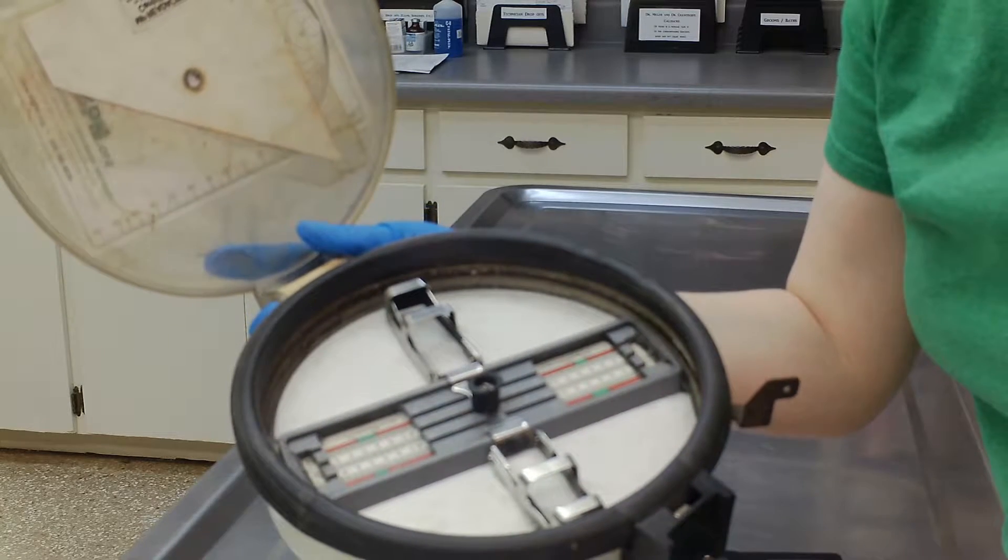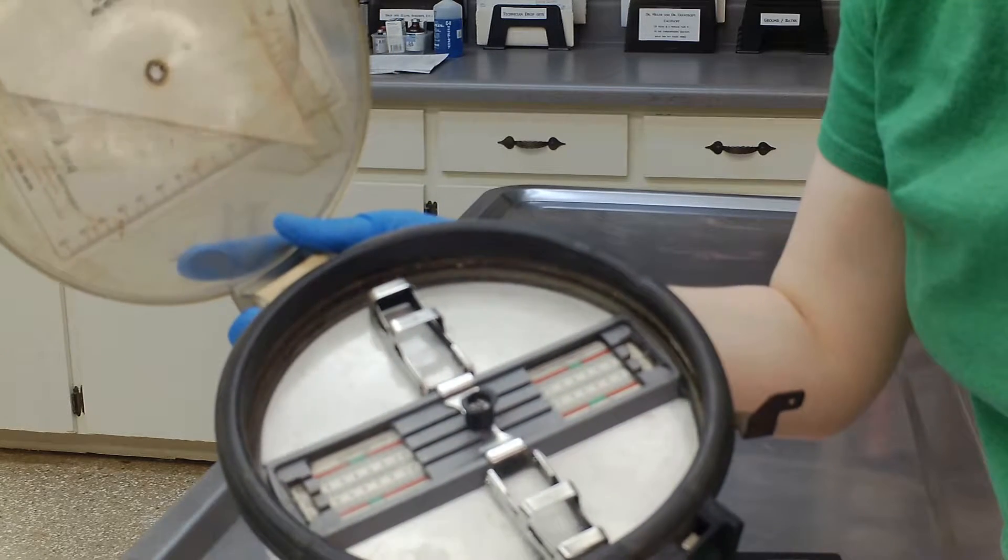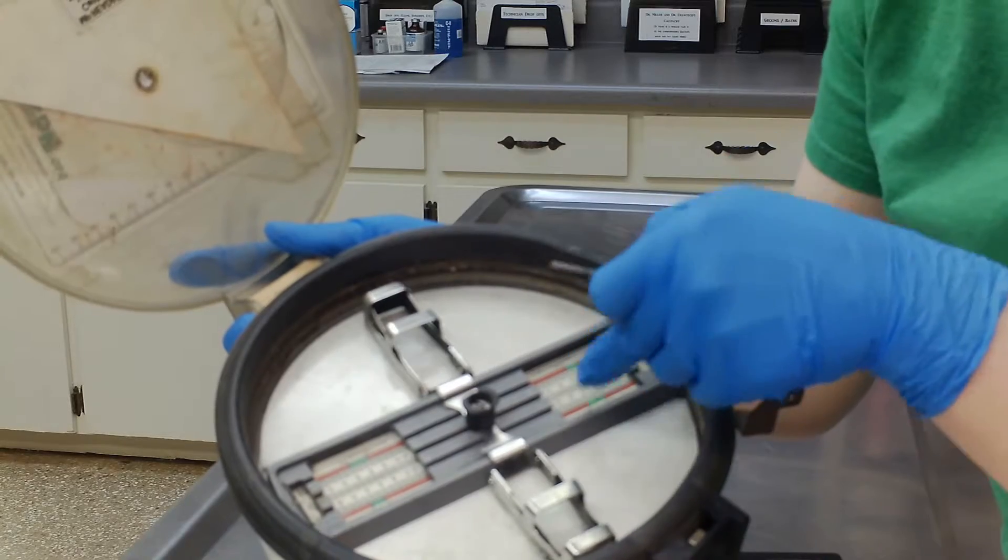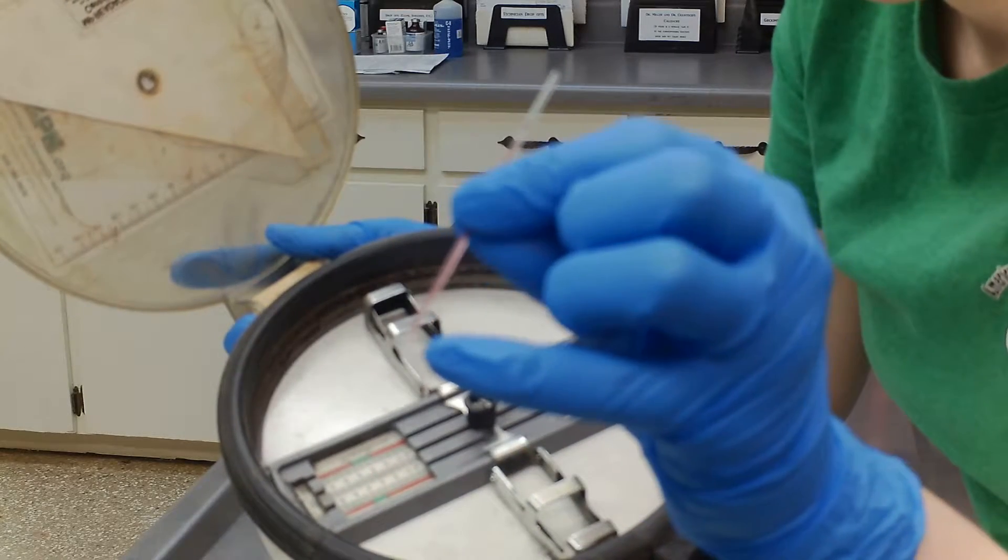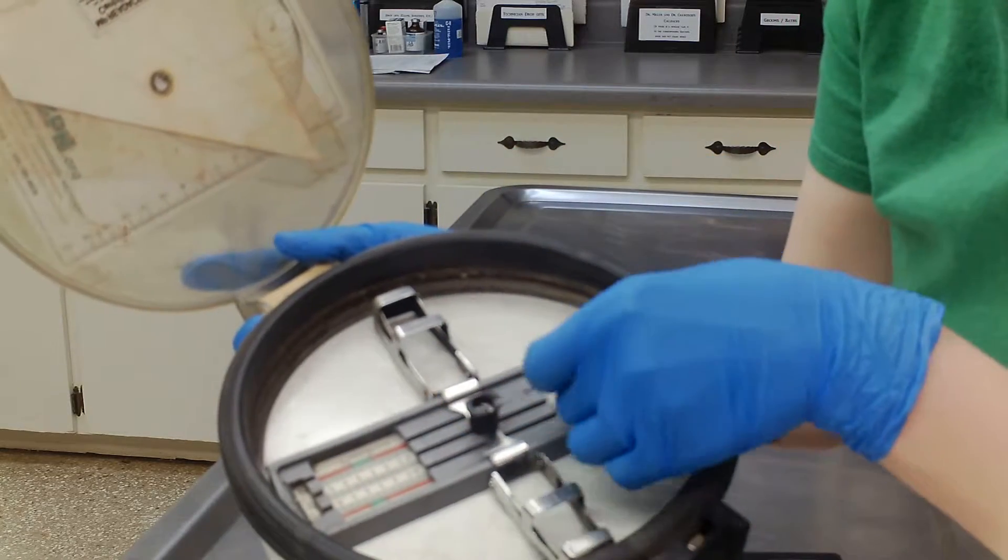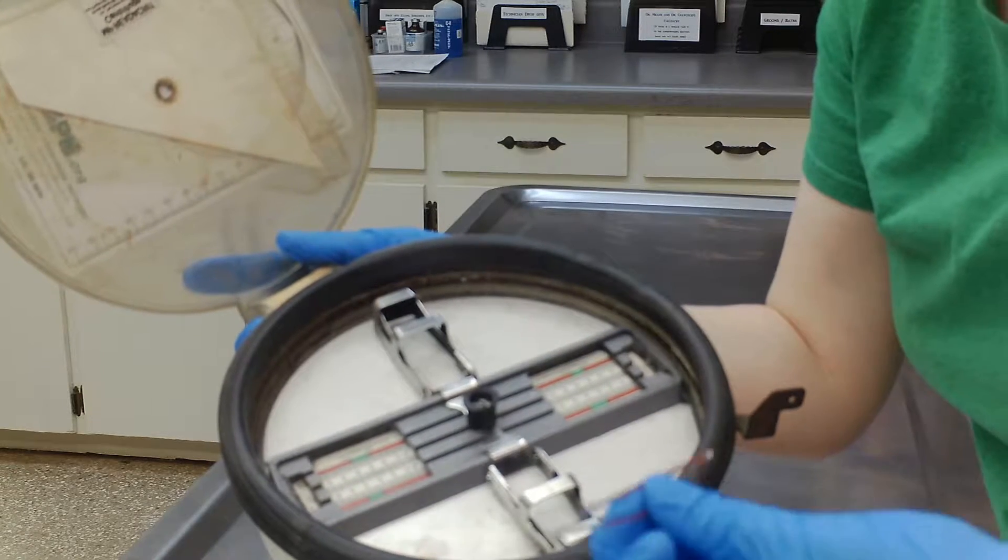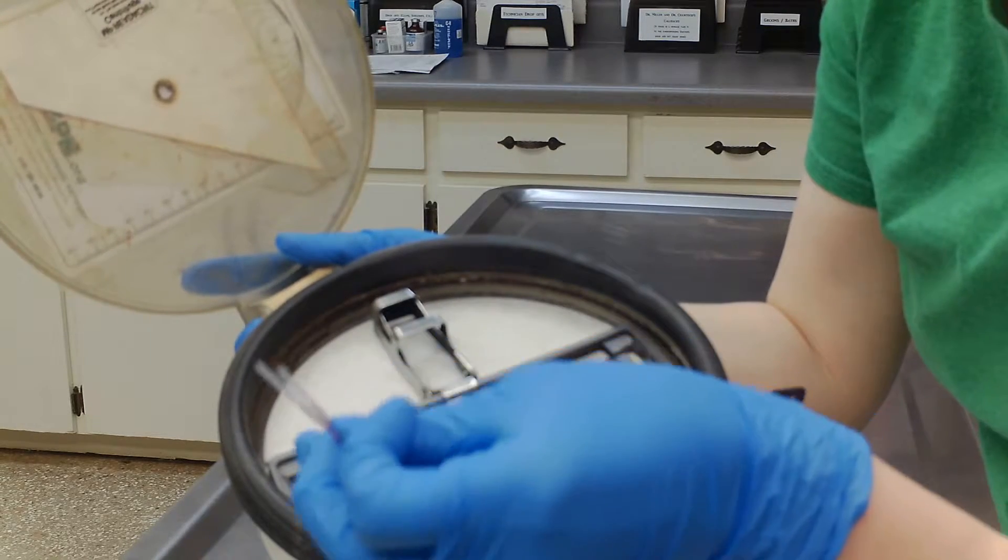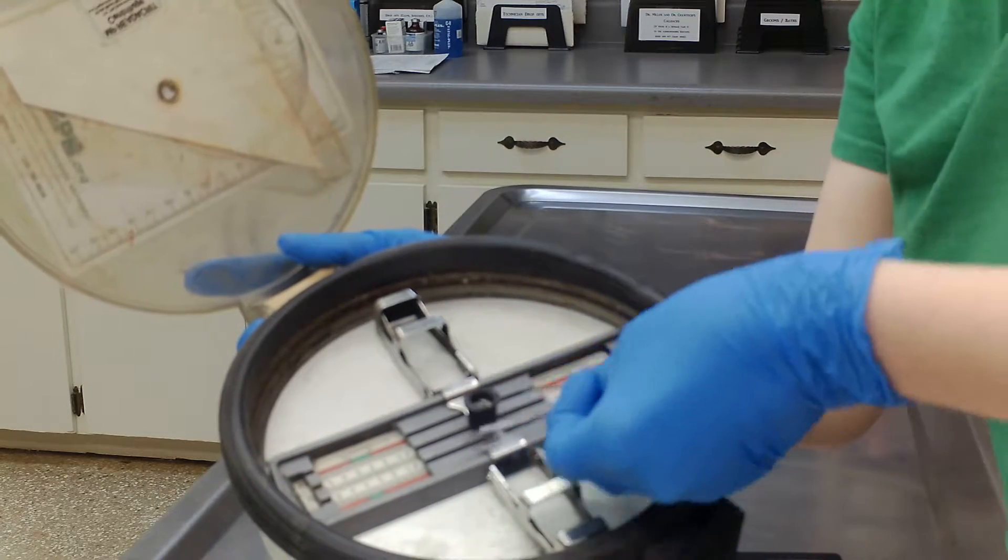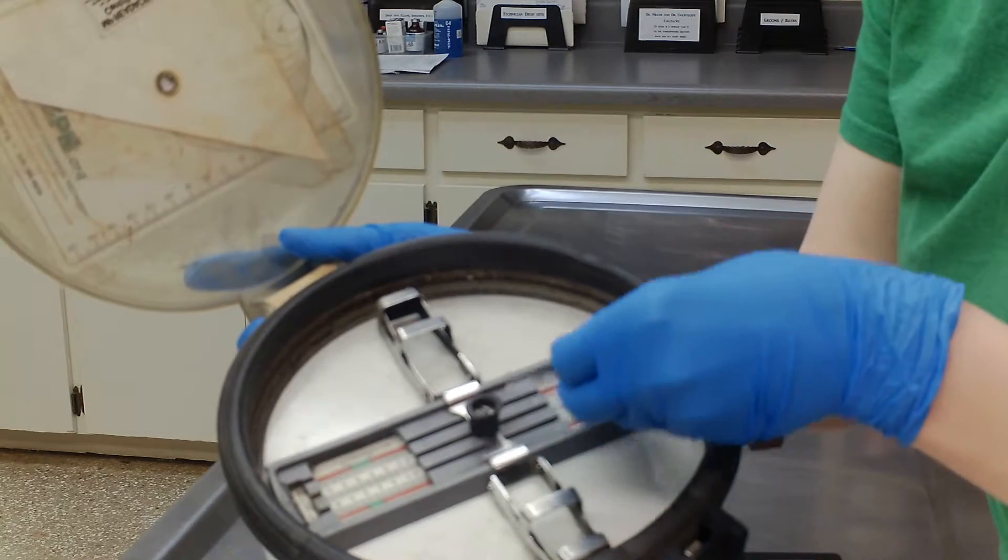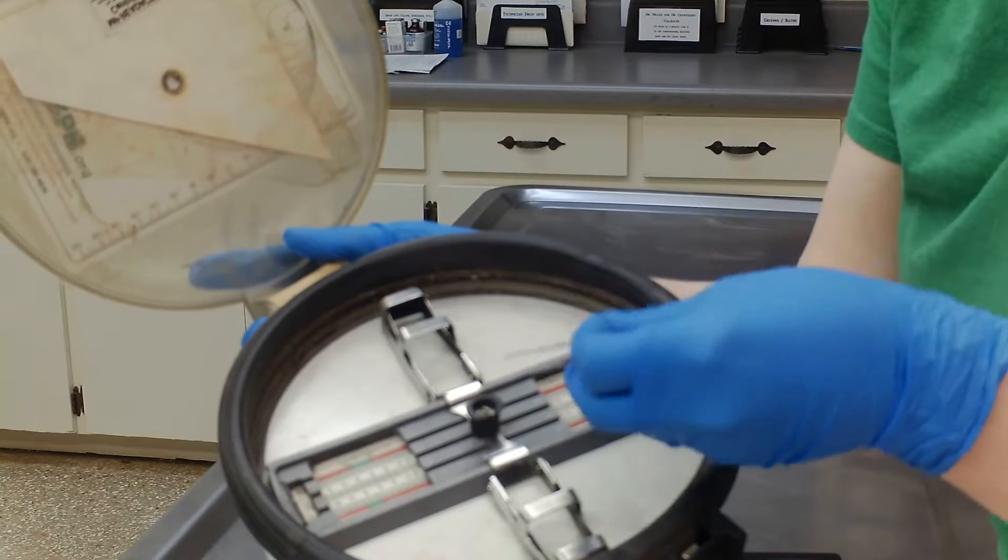How you would do this is, you see the little clay down here at the bottom, I would put the clay spinning outward. If we had multiple different patients doing PCVs at the same time, we would make sure that we know which one our particular patient is.